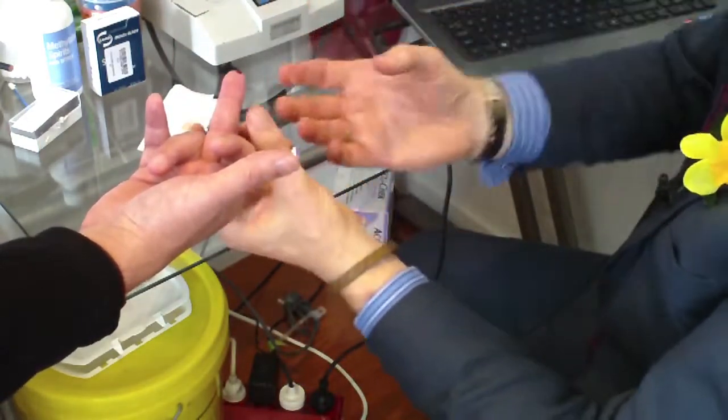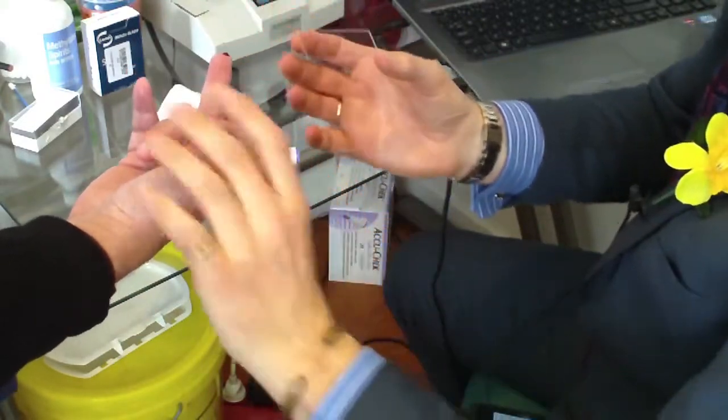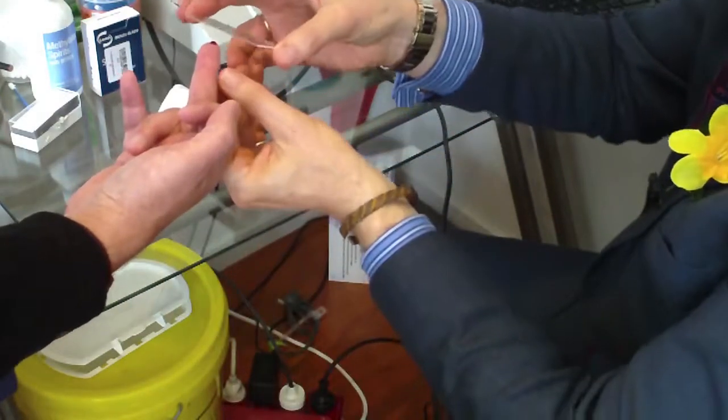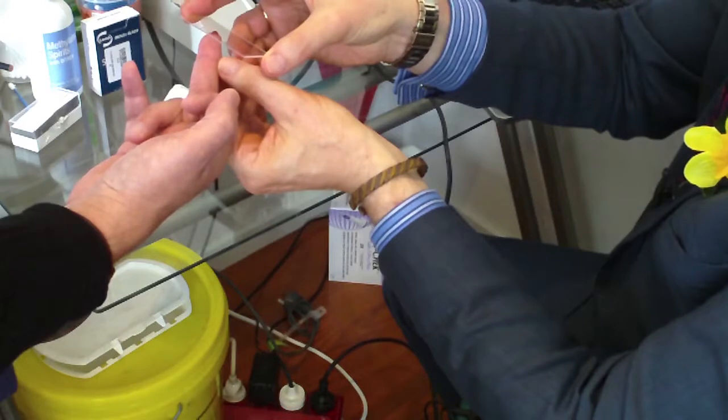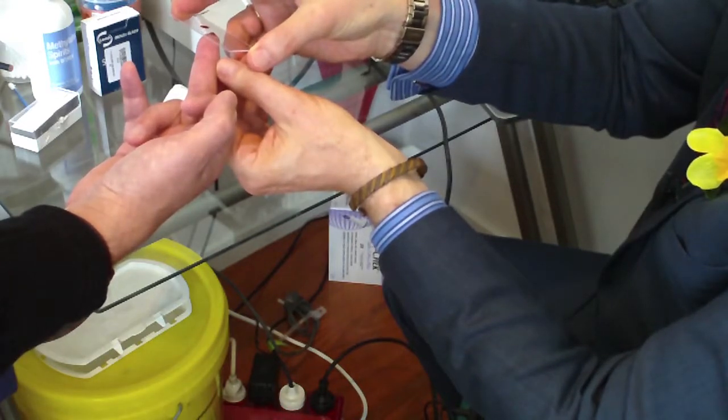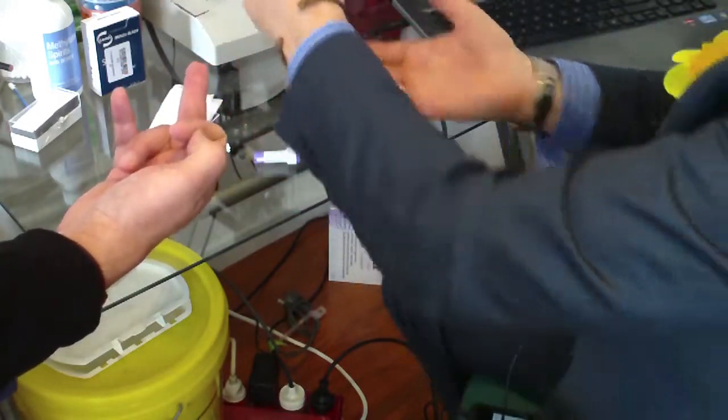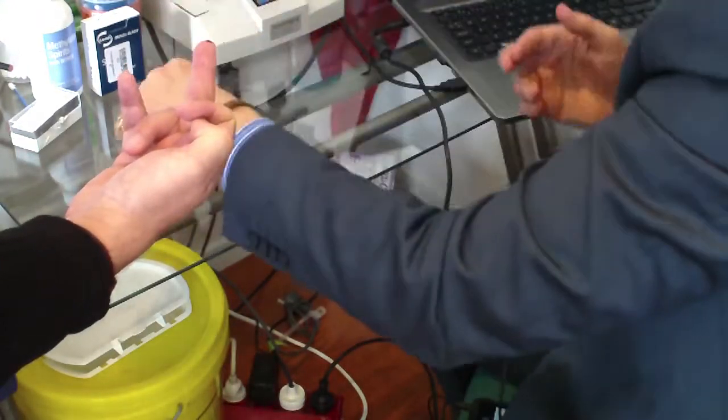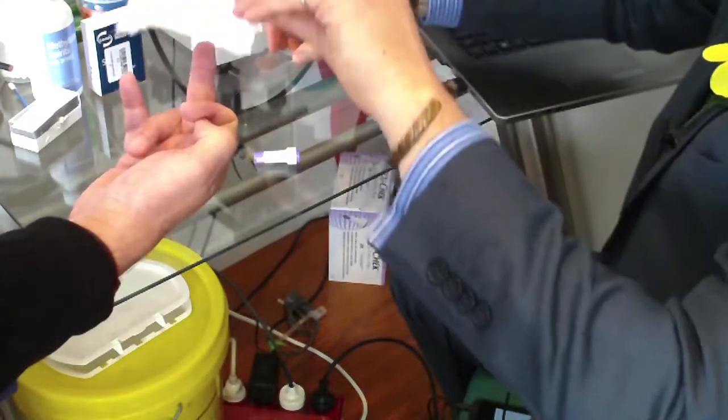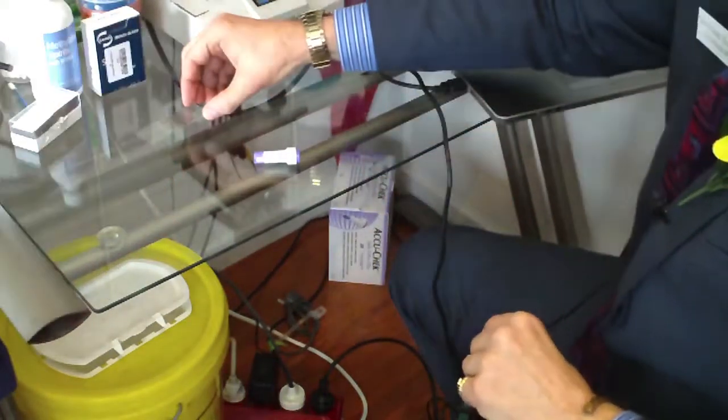So we gently keep it really still, capture the specimen like so. This is for the wet analysis. And we've got a great, nice slide there. And the next one, I allow a meniscus of blood to form, which is beautifully formed. Just rotate the hand like so. And we're going to get four specimens, one after the other. And then we put that to dry, give the patient a tissue, and then we're going to look at the blood.